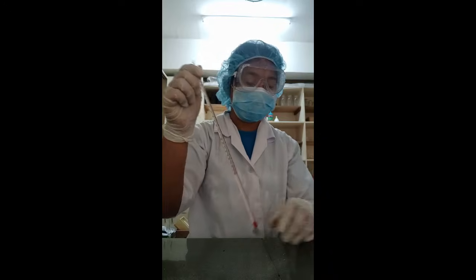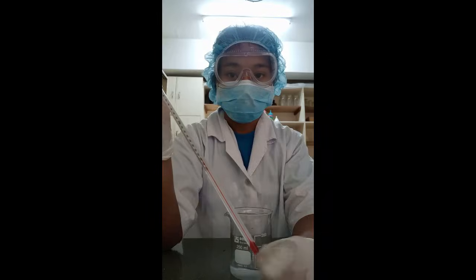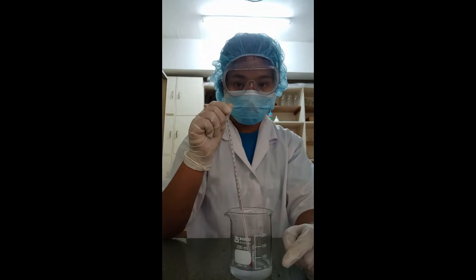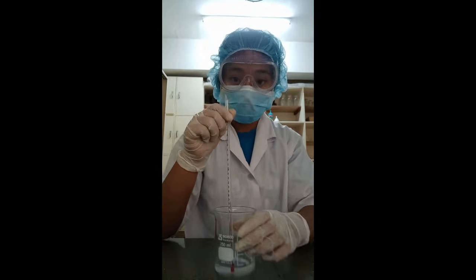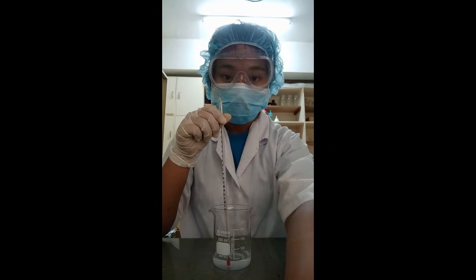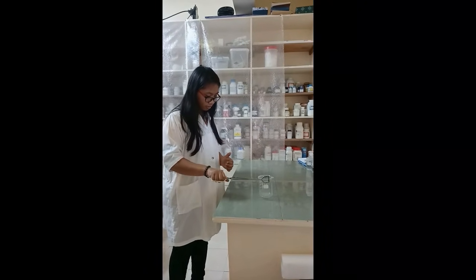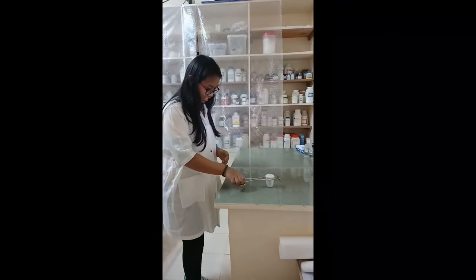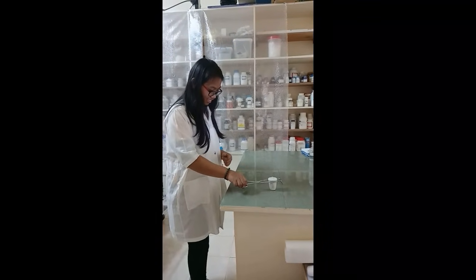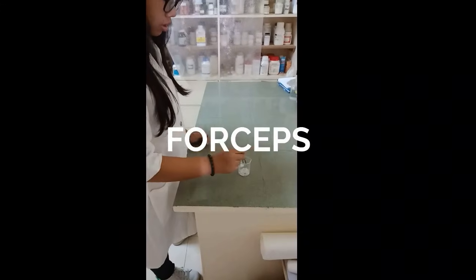Thermometer. It is used to measure the temperature of a substance or a liquid. Tongs. It is used for grabbing things that should not be touched by hand, and it is used to hold beakers, test tubes, and other apparatus. Forceps. It is used to grab small things like solid chemicals and broken glass pieces.